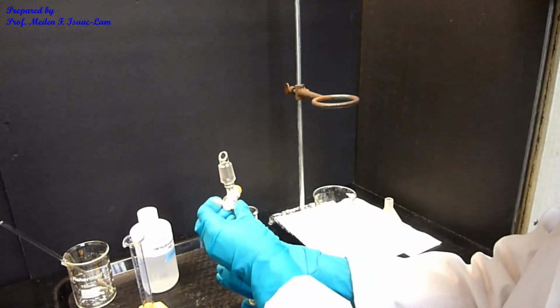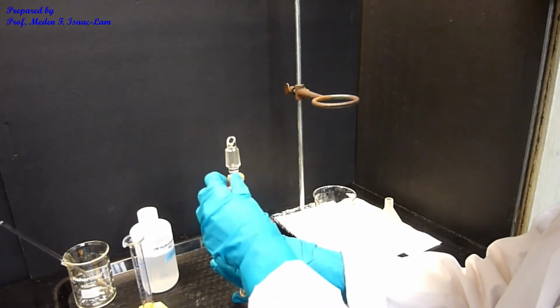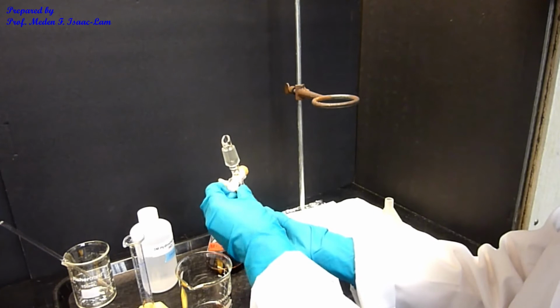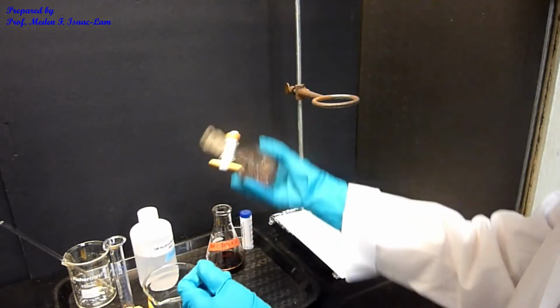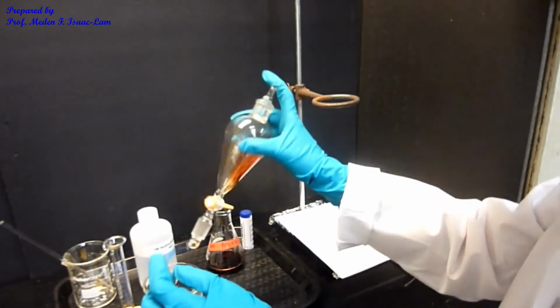We did again 2 extractions of 10 ml of the acid this time; earlier it was the base. Again, release the pressure so that pressure buildup doesn't accumulate and leak out around your stopper.